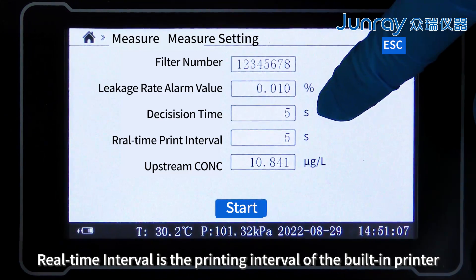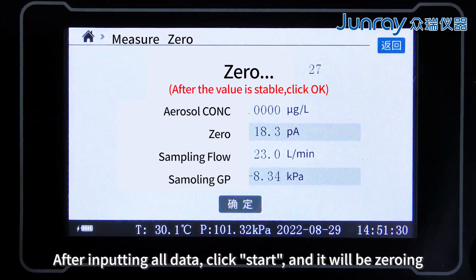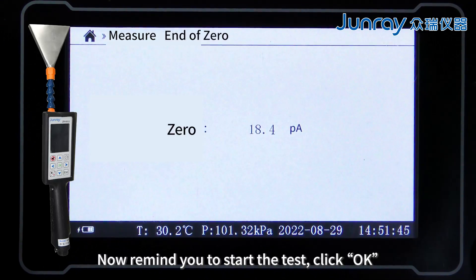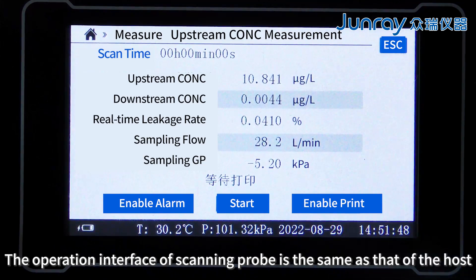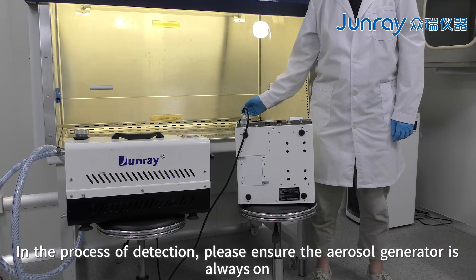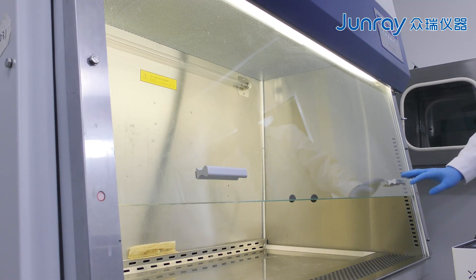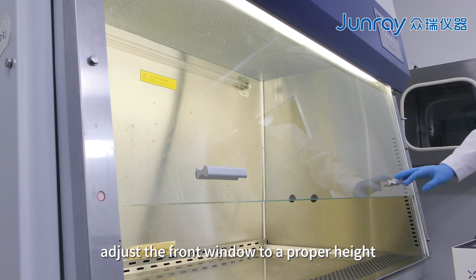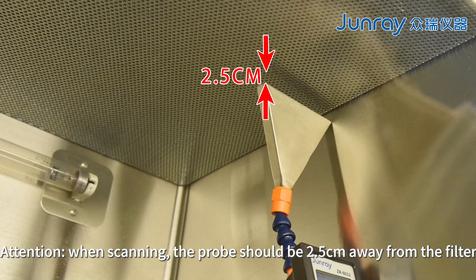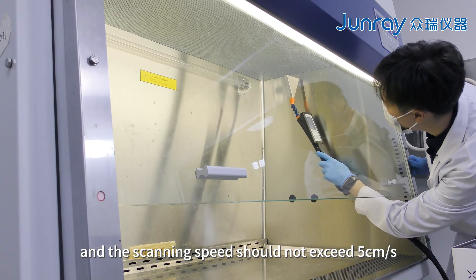The real-time interval is the printing interval of the built-in printer. The upstream concentration is as just determined. After inputting all data, click start and it will begin zeroing. When prompted, click OK to start the test. The operation interface of the scanning probe is the same as that of the host. During detection, please ensure the aerosol generator is always on and turn on the fan of the BSC to ensure normal operation. Adjust the front window to a proper height. When scanning, the probe should be 2.5 cm away from the filter, and the scanning speed should not exceed 5 cm per second.